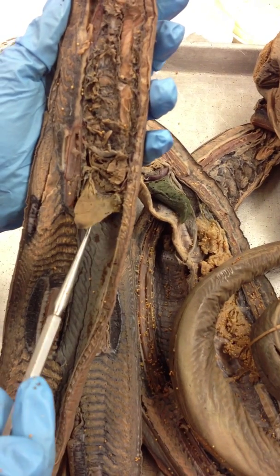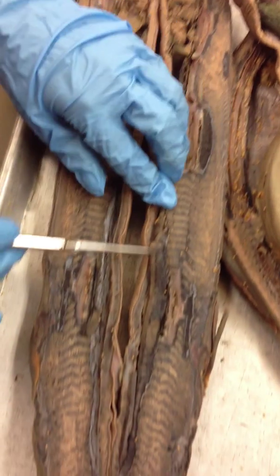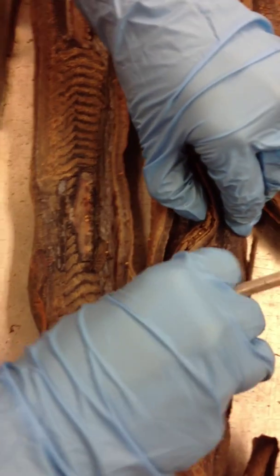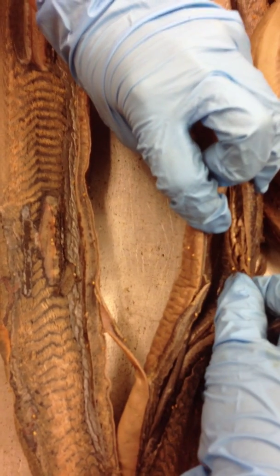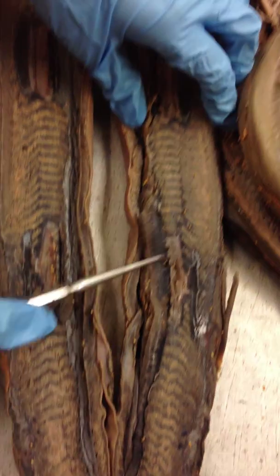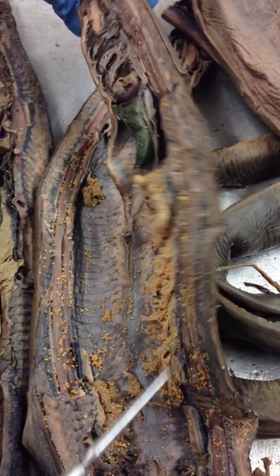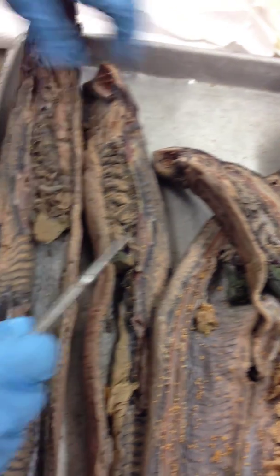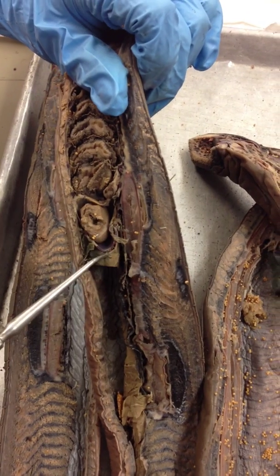Here's your large liver, and your kidneys are this long thing right here — the other one can be seen if you flip this over. Here's your male gonads, your female gonads with eggs, and here should be your heart. Right here is a better one — this is your heart, up here above your liver.